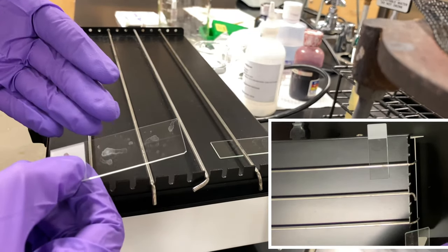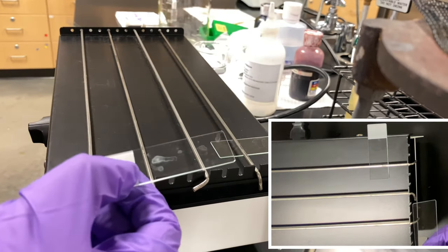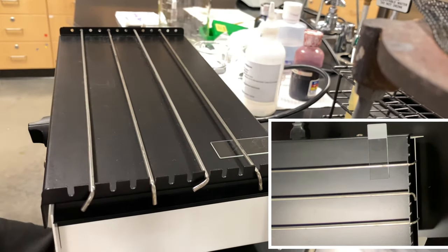You create the smear and then heat fix it. Once it's nice and dry, we can actually proceed with the next part of the protocol.